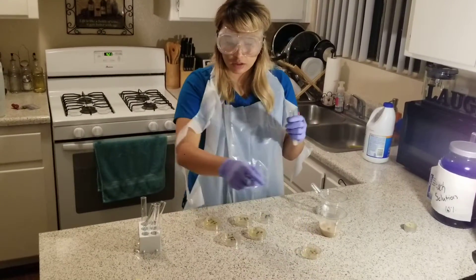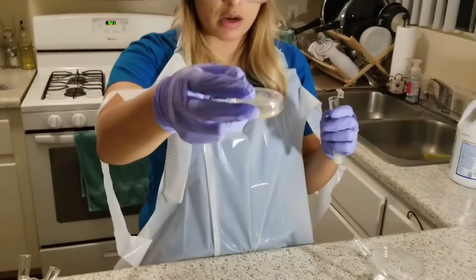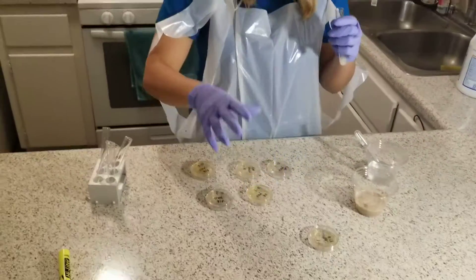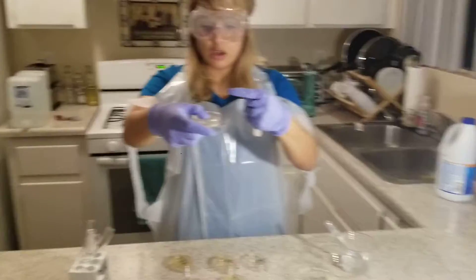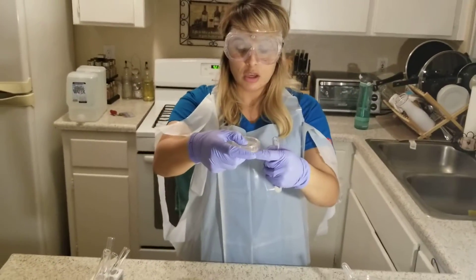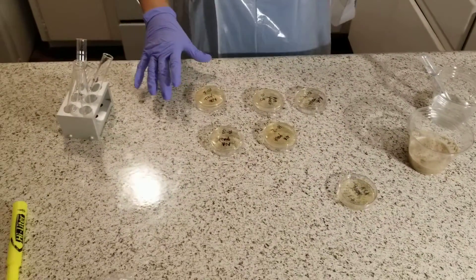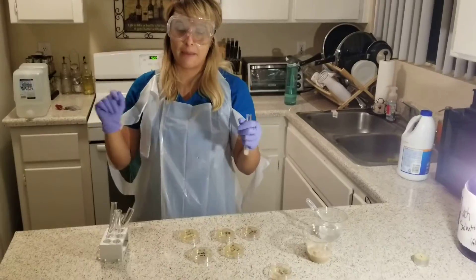After that, I will let them sit for 12 hours with the agar at the bottom and the lid at the top, so that the liquid can grow into the agar. After it has set in after 12 hours, I will invert the plate — turn it upside down — so that there's no contamination from the lid that will go into my microbes. At the end of the 12 hours, I will flip it over so that the microbes can continue to grow. I will do that for the remaining plates, and that concludes my bacterial enumeration dilution lab. Thank you.